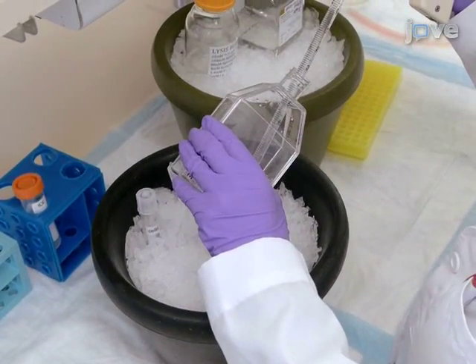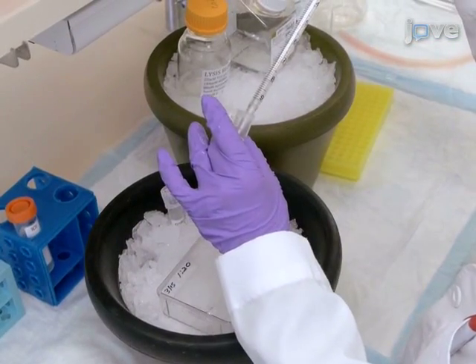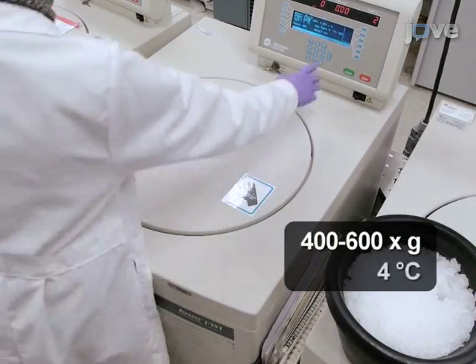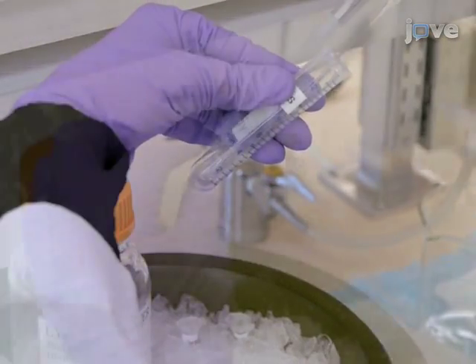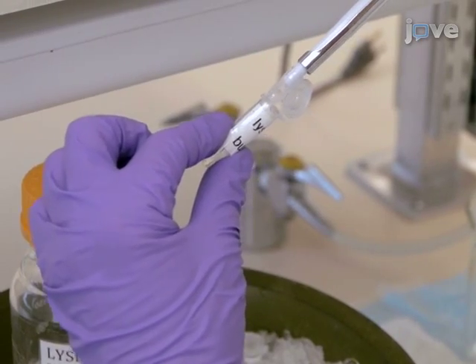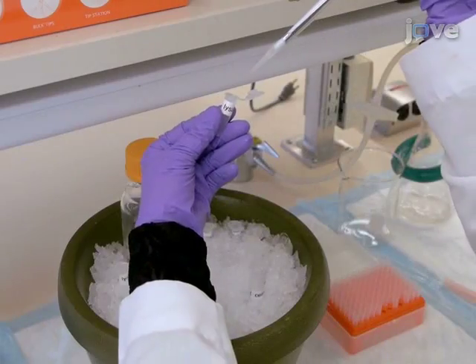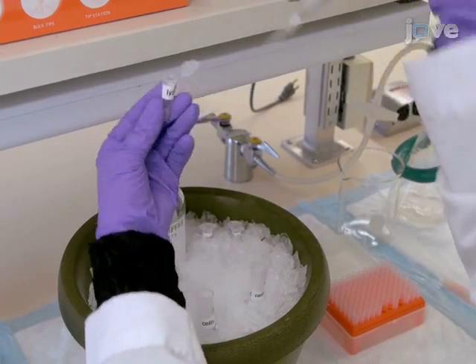Resuspend the cells in 10 milliliters of ice-cold PBS and transfer to a pre-chilled 14 milliliter round-bottom centrifuge tube. Pellet the cells by centrifugation at 400 to 600 Gs and 4 degrees Celsius for 5 minutes. Remove the supernatant and resuspend the pellet in 200 microliters of ice-cold lysis buffer. Transfer the suspension to a pre-chilled 1.5 milliliter Eppendorf tube.